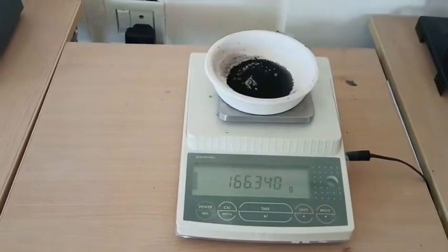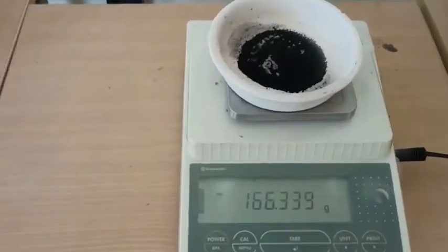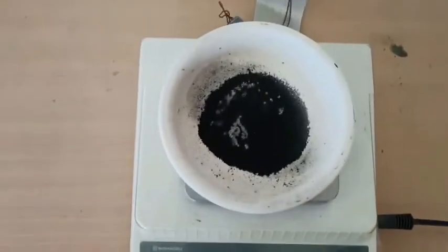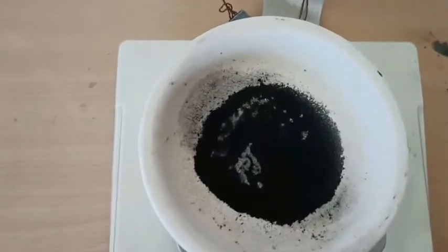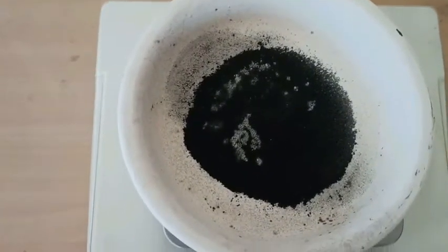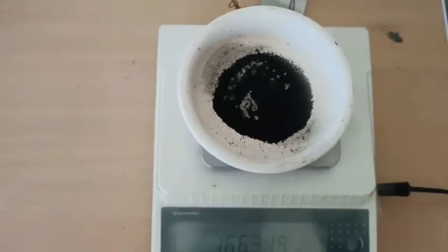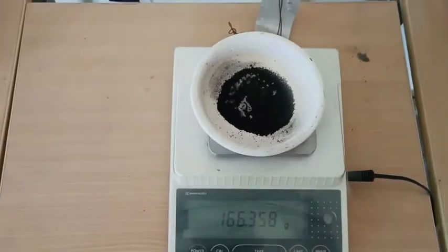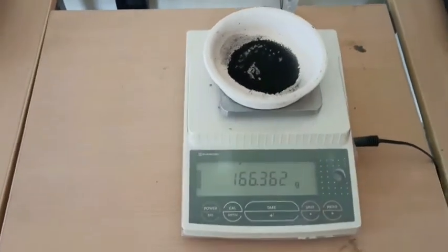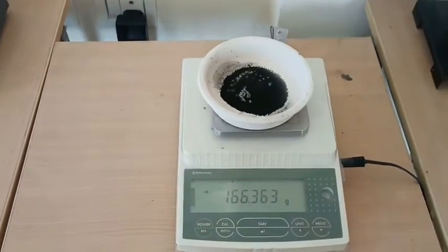Now we keep this sample in the desiccator. This is the sample we obtain after volatile material removal. Here you can see that after removal of volatile material it is black, because we used a lid.